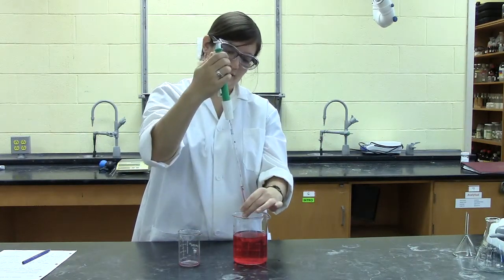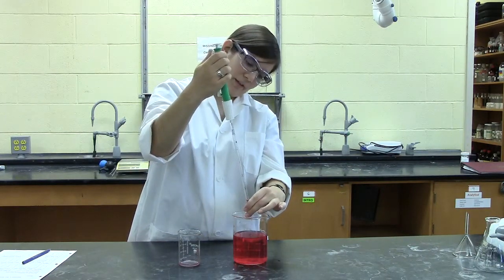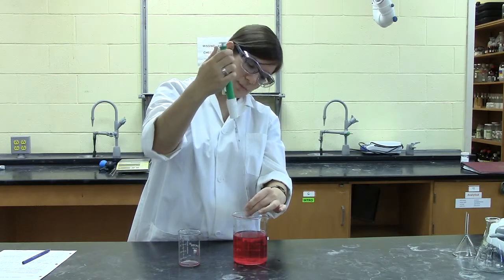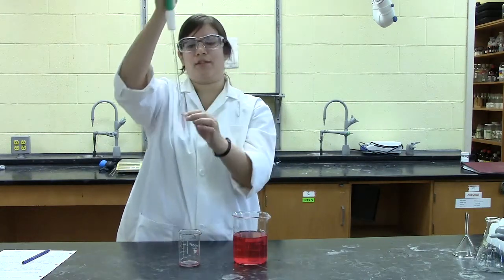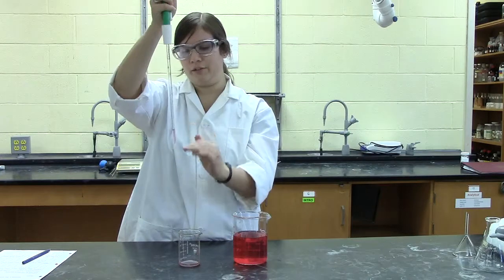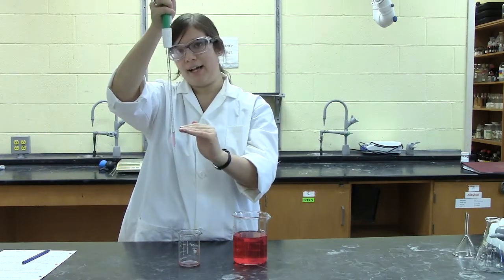The other method of using this is, say you want to add exactly one milliliter, simply fill the measuring pipette reading from the bottom of the meniscus to the line measured four milliliters which, from the bottom up, is exactly one milliliter.